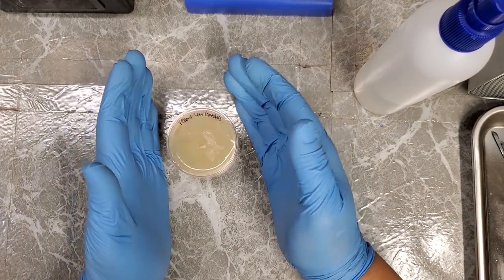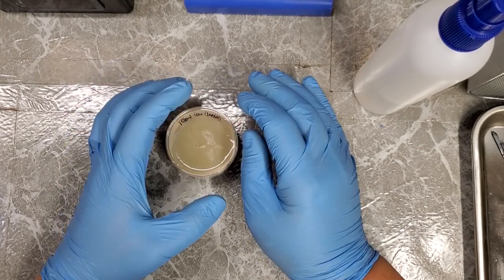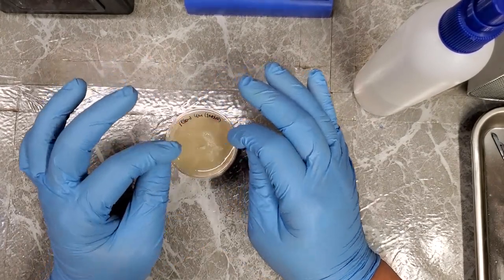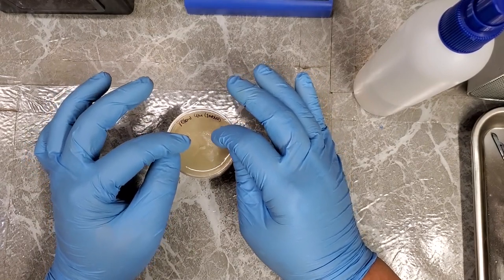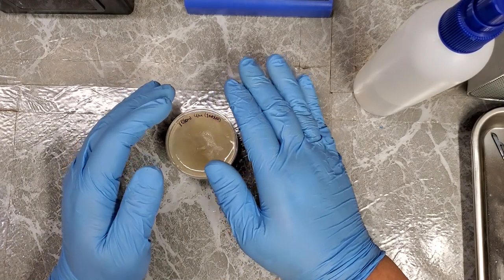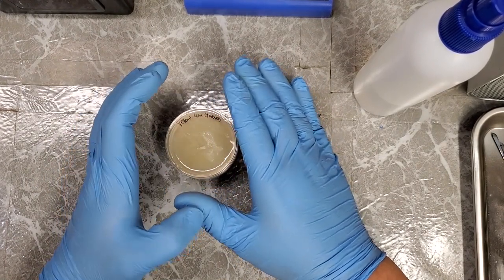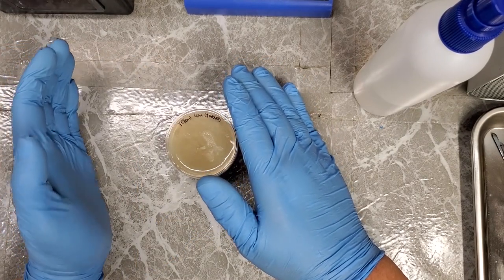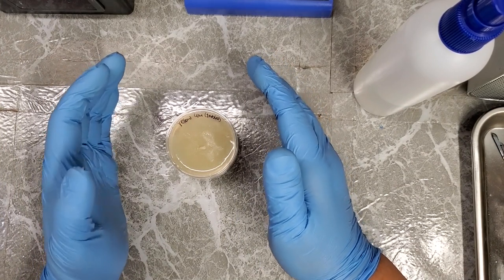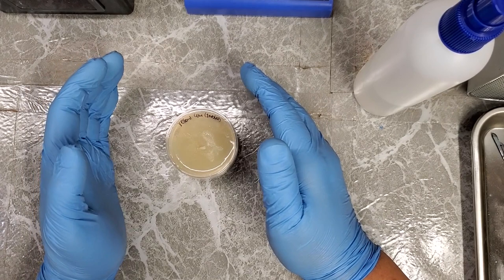And even if you get to this point and a few days later or a week later you start getting some pretty decent growth, but even if your transfers have slight contamination, just repeat exactly what I did here, and typically you can get a pretty clean sample with one or two transfers. Sometimes it does take a few transfers, so don't feel too bad if you transfer one tissue sample onto a clean Petri dish, hoping to be devoid of any contaminations, yet you still end up with a contamination. Sometimes it does take a few transfers.